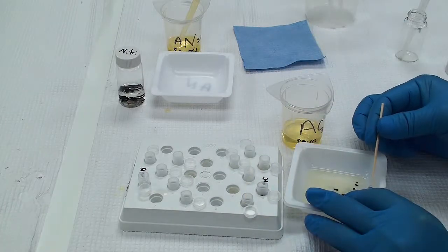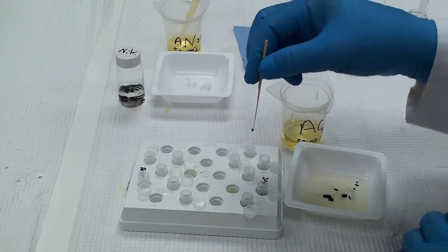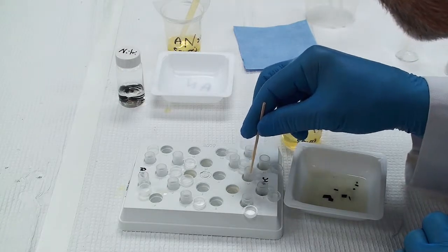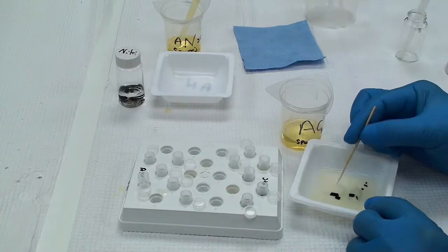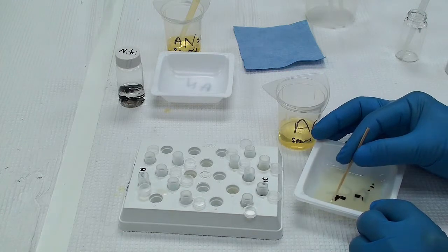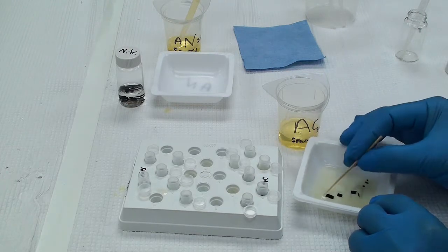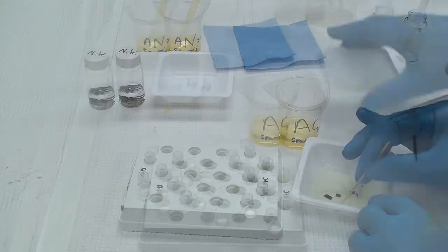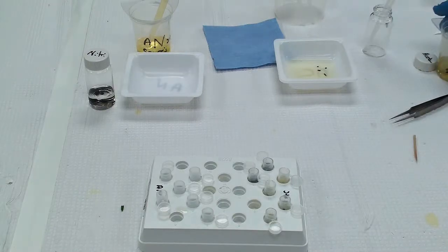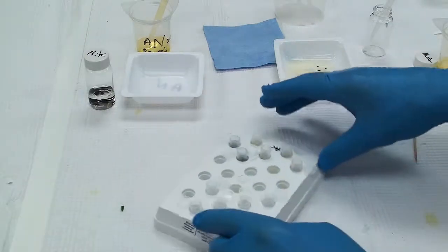And then I've also done some very large plant. I put that in there. Now I've cut the catalpa very large on purpose because I want to check and see if this automated infiltration system will work for that as a sort of a negative control. Now I've gotten my acetone done. Now I'm going to do the same with my acetonitrile.